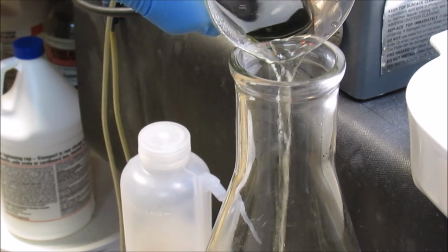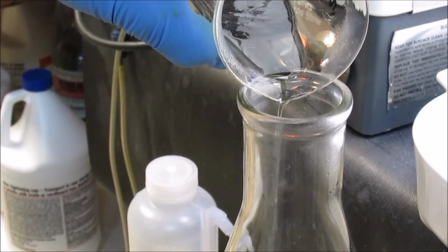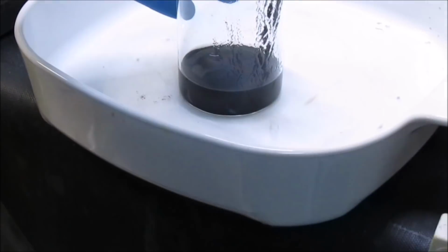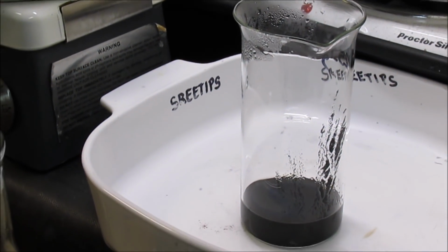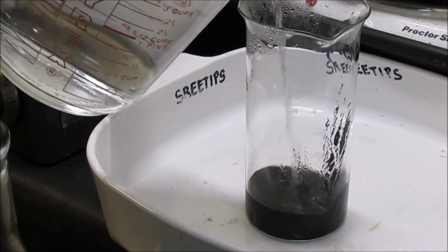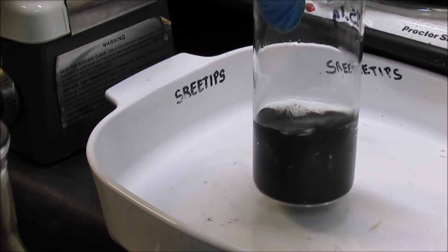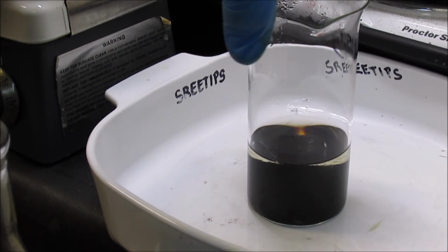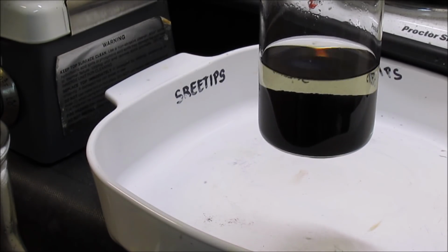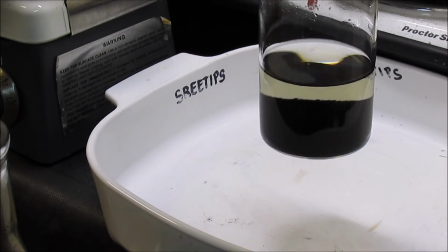It's at the right state of where I want it to be. I can just pour it off without any of the black PGM powders coming over. And then I'll just keep doing this and keep rinsing it. Watch how quickly the solutions, the powders settle. This is hot distilled water I'm pouring in here now. And you'll see that it settles very quickly. See that? See how quick it settled? And that's a good sign that we've got some clean black PGM powders down in the bottom of that beaker.